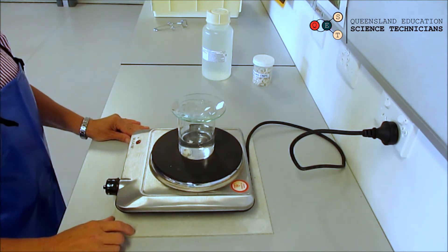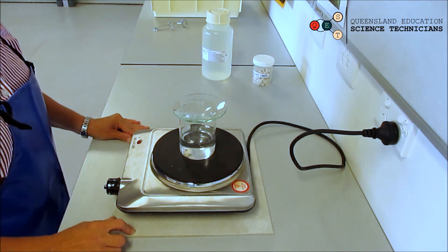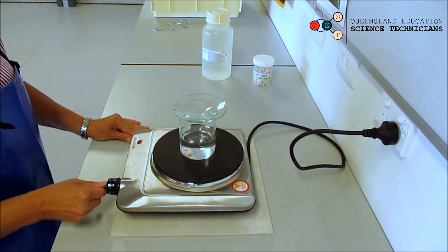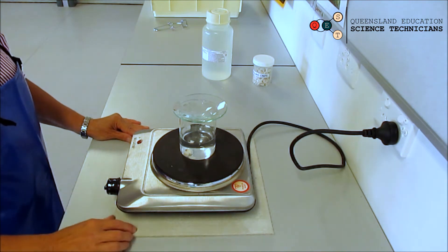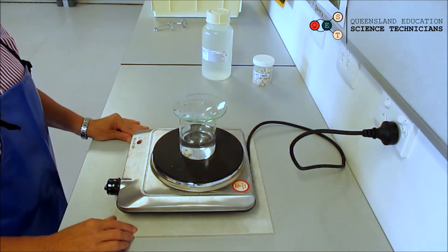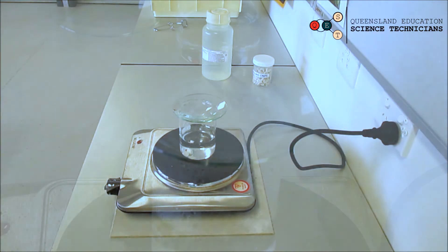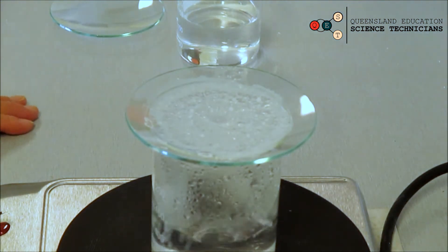Once you've let it evaporate and boil away for a while, you can turn it all off. As you can see, you're left with your salt on your watch glass, so all the water has evaporated away.